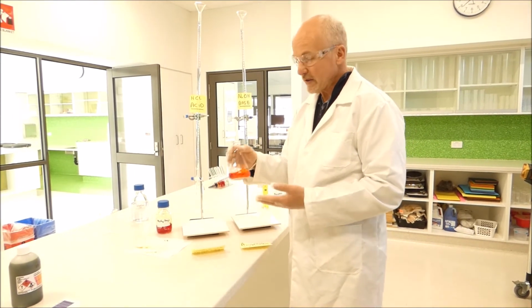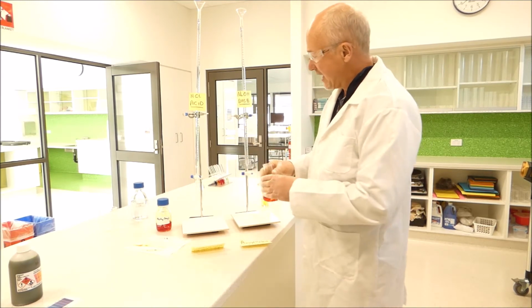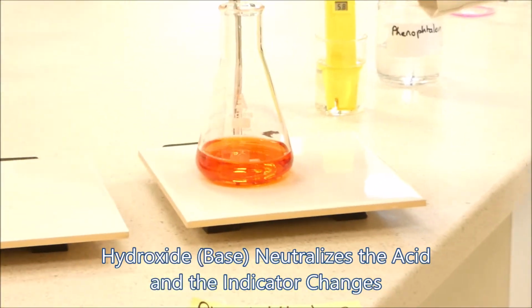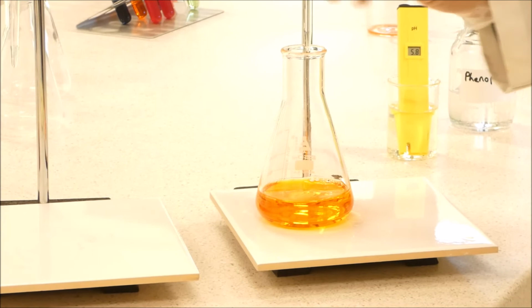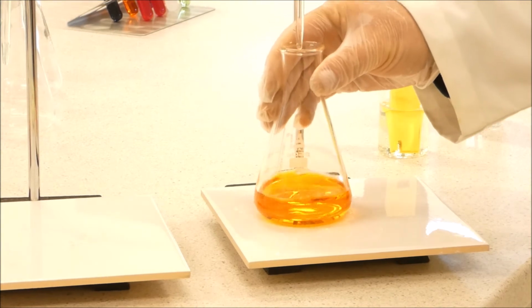And similarly with methyl orange, which was the acid indicator, we added hydrochloric acid to get it to turn to the ruby reddish colour. And if we put hydroxide ions in the form of sodium hydroxide into it, it will then turn back to the yellow colour as well, showing that the indicator is fully reversible and that it has become more basic, has gone back towards neutral and has turned back to the yellowy orange colour.